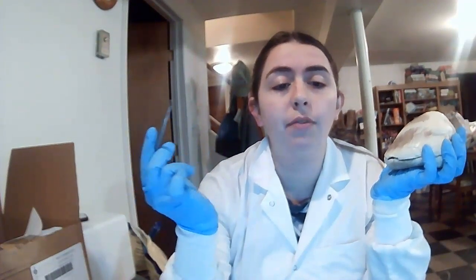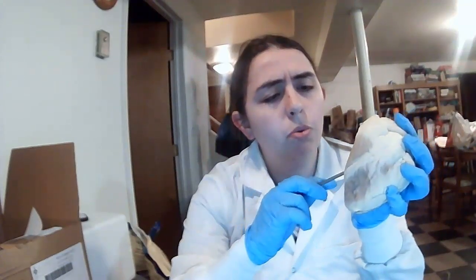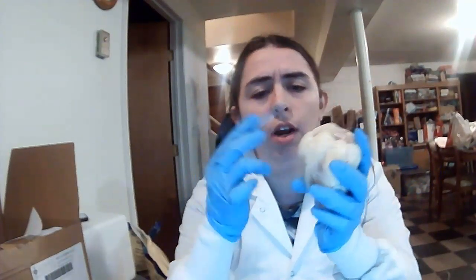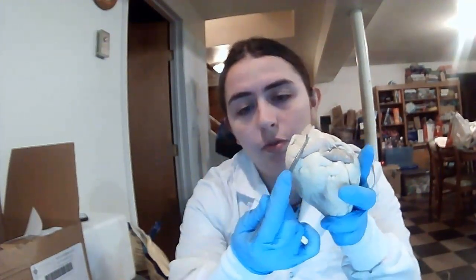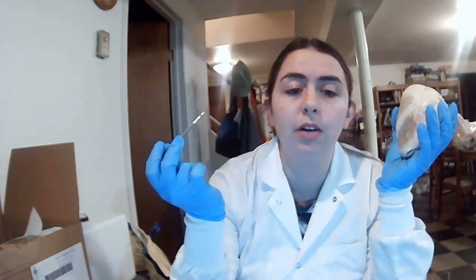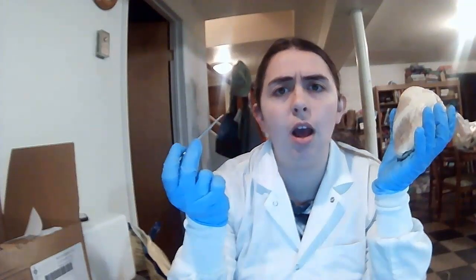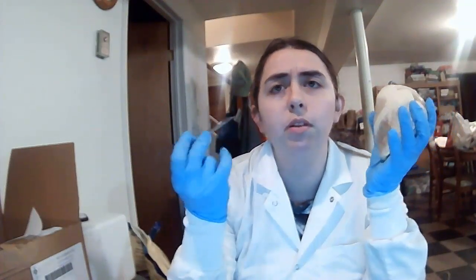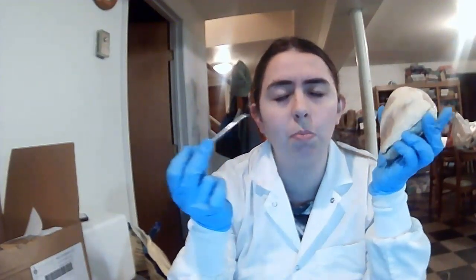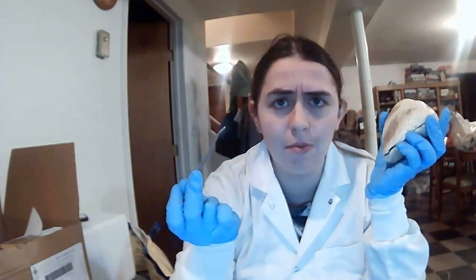Then the next valve we have is the tricuspid valve, which is located between the right atrium and the right ventricle. And then one of the valves on top, roughly in the middle, roughly right there, is the aortic valve. This is the most upper valve, and it takes the oxygenated blood and transports it to the rest of the body system.